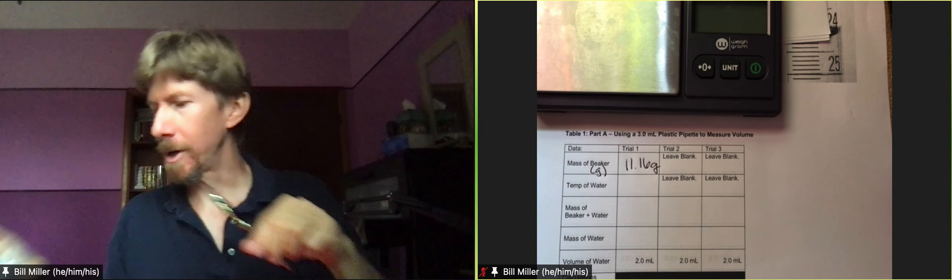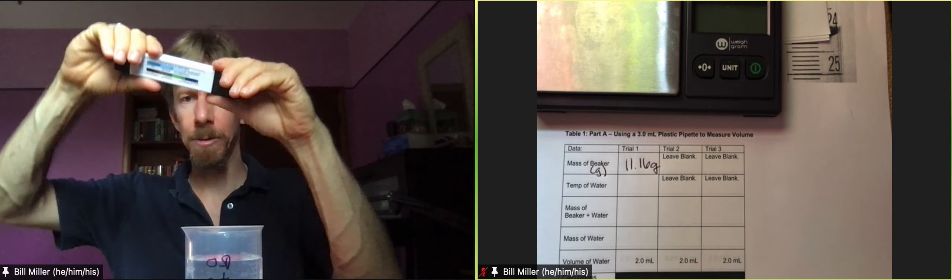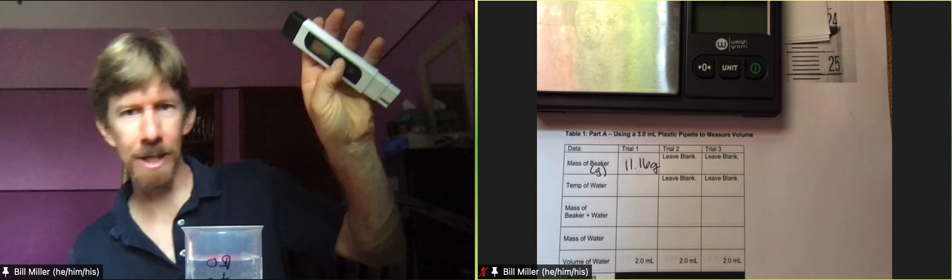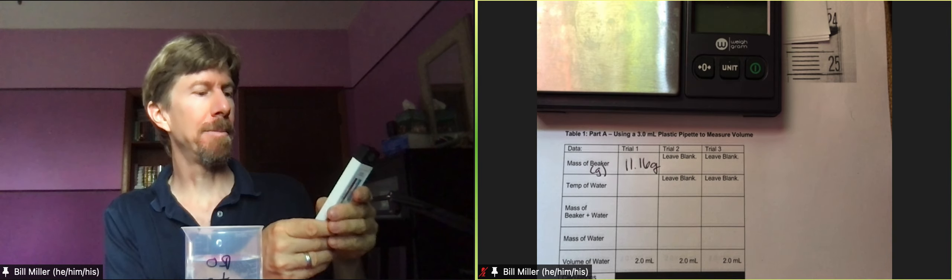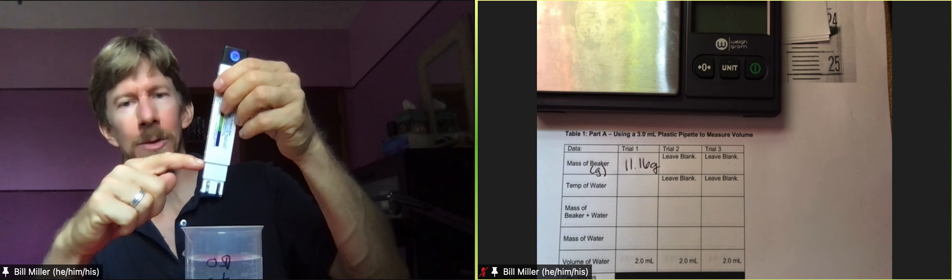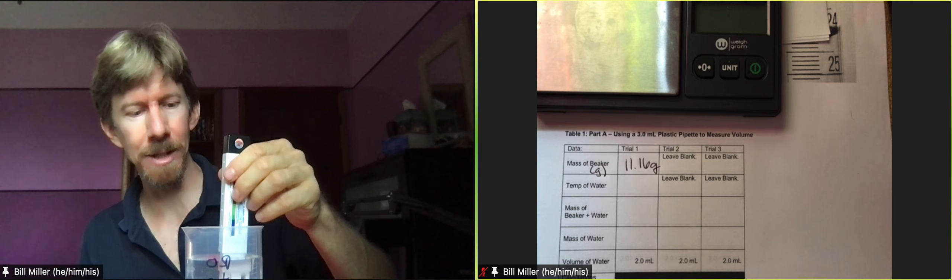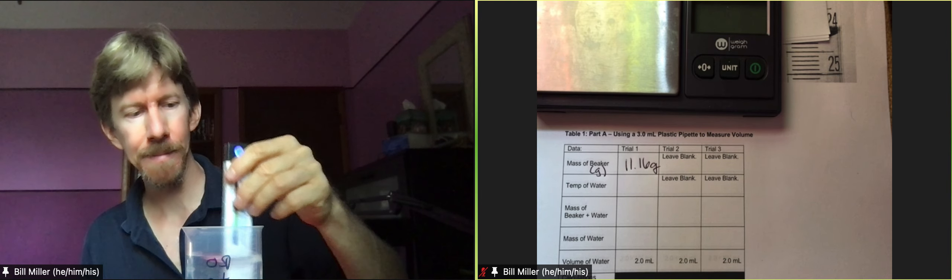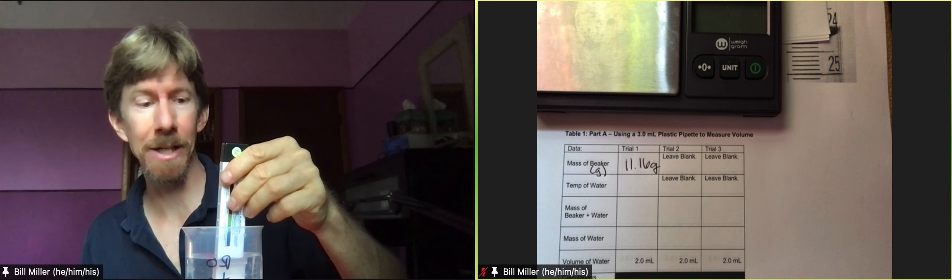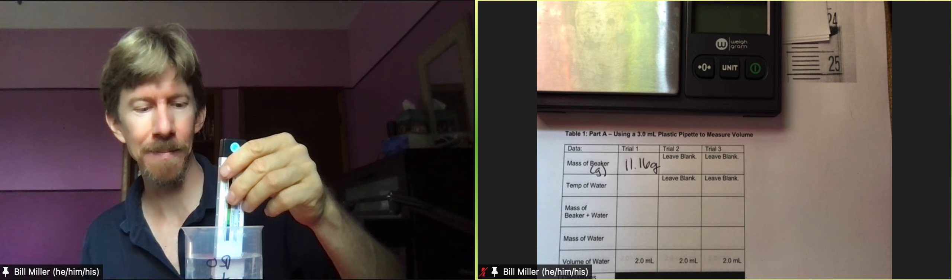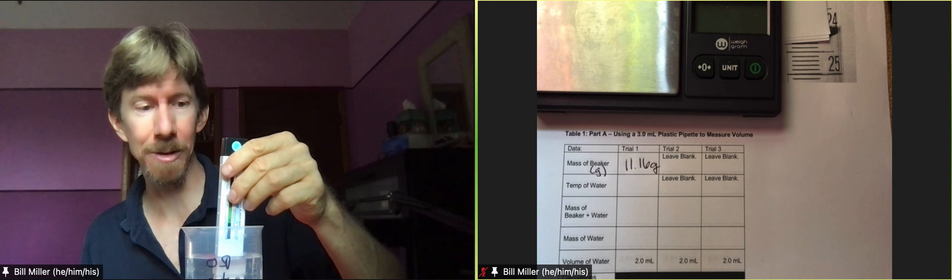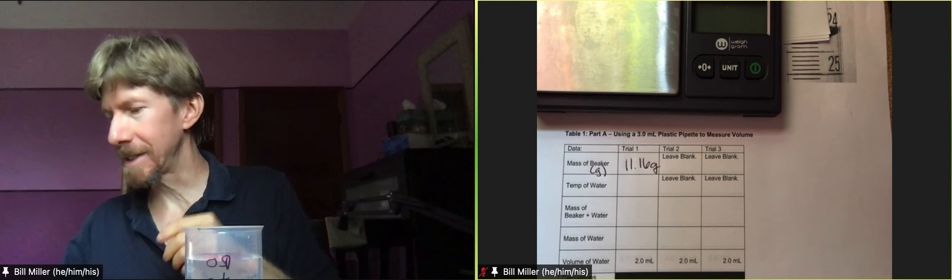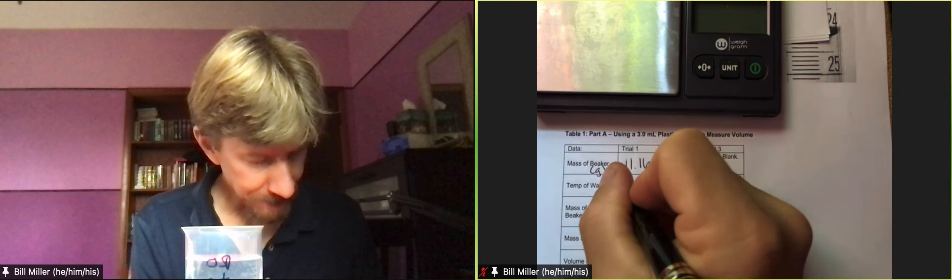Now I'm going to take the temperature of my water. I'm going to remove my cap, it's not the pH one it's the other one. I'm going to press and hold to turn it on, I'm going to press mode twice to get it into temperature mode and then I'm going to put it in only up to about right there, only where the cap goes. I'm going to put it in, I'm going to swirl it around for five or ten seconds. Mine's not changing very much, mine says 26.3 degrees Celsius.